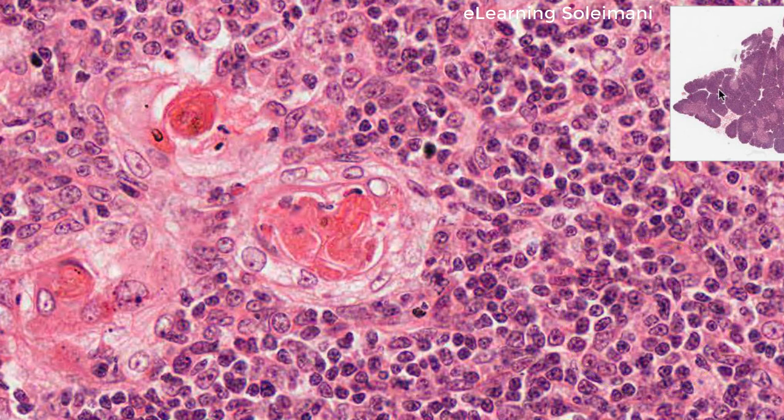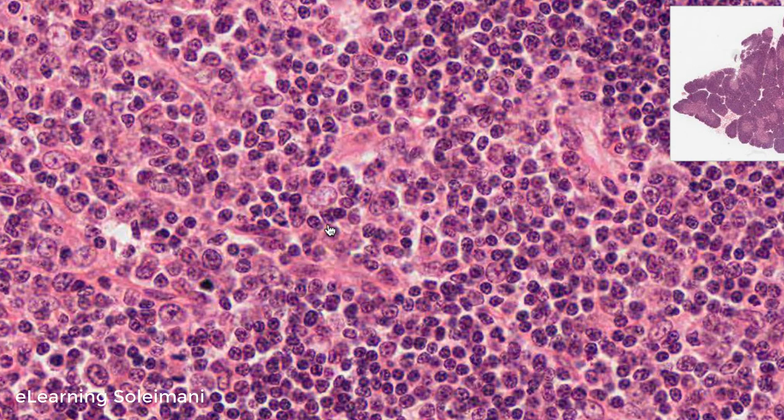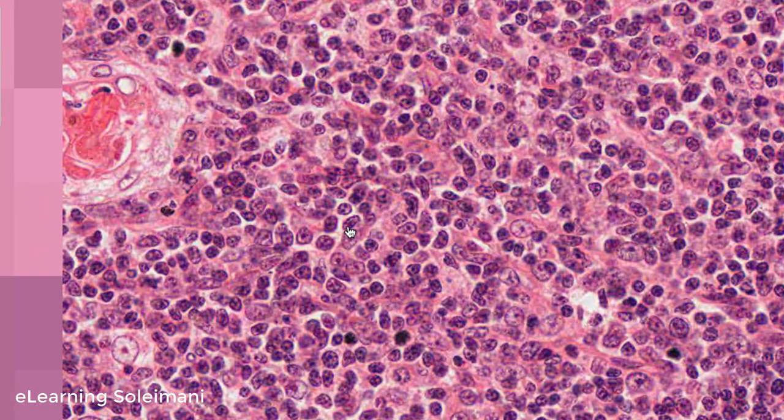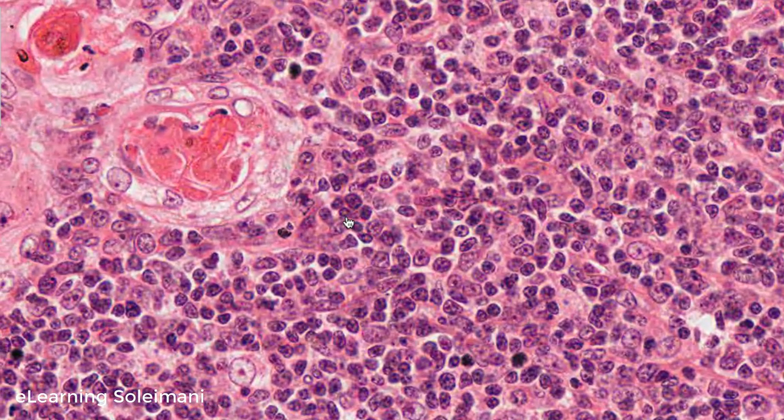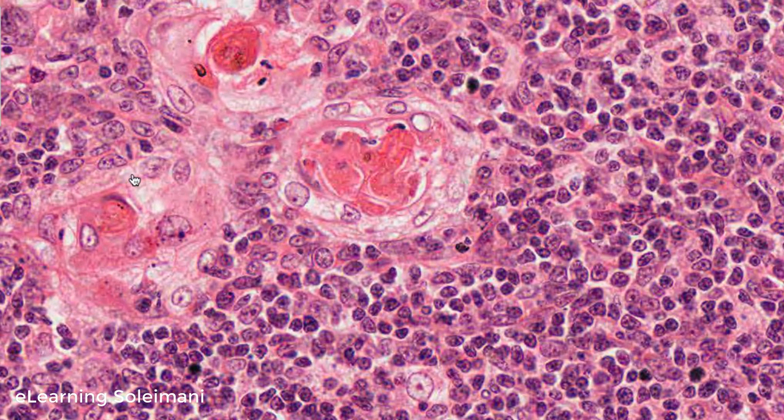As we increase the magnification, the epithelio-reticular cells become more visible. Pay attention to the size of the cells. Epithelio-reticular cells are bigger and lighter. Now move towards the center in the Hassall's corpuscle. Here we see the epithelio-reticular cells that are bigger and lighter in comparison to lymphocytes that are smaller, and their darker nucleus takes all of the cell's space.